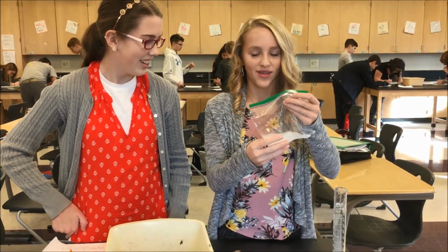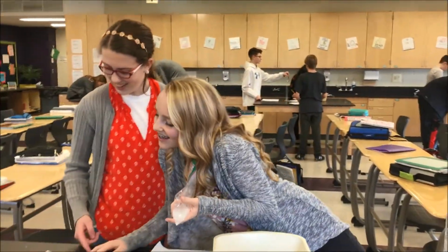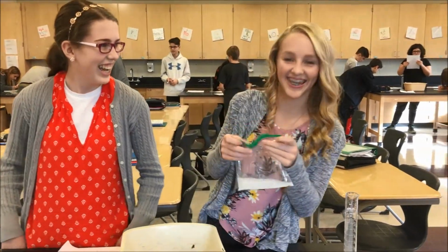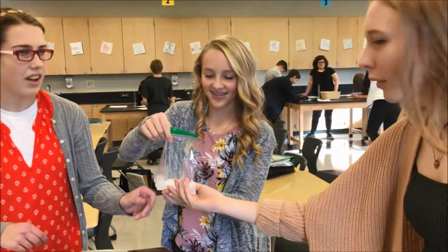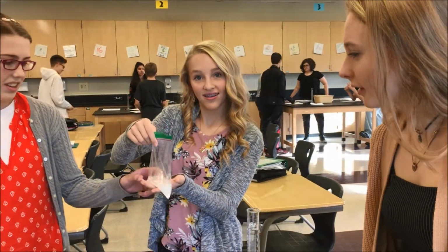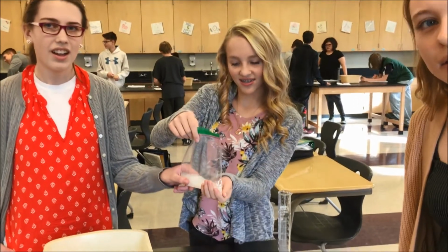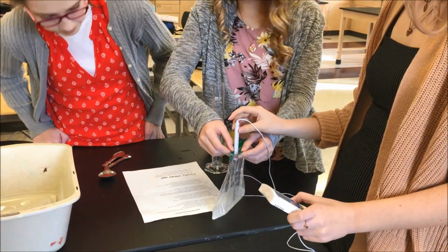Oh, it's warm. Is it really? It's warm. Excellent one. Okay. Cool. And the last thing we need you guys to do is take a temperature and calculate the difference from the original. It gets really warm, doesn't it? Kind of nice. So it increased 19.